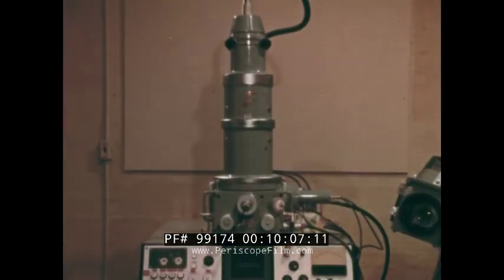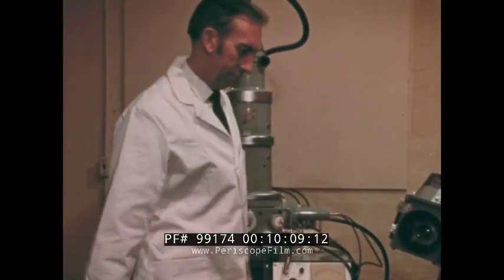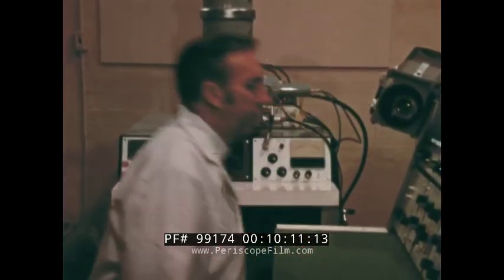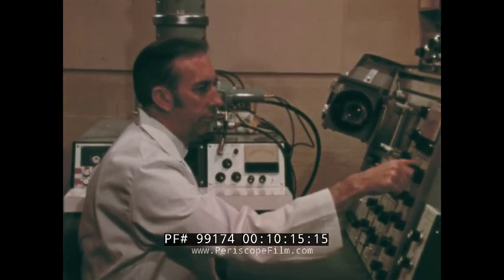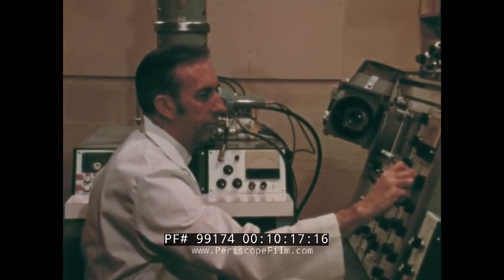How does this new instrument work? Unlike the light microscope and the conventional electron microscope, the scanning electron microscope does not form an image by means of a lens. In the light microscope, light passes through a more or less transparent specimen and then through curved glass lenses in order to produce a magnified image of the specimen. It can be viewed directly by eye or can be recorded on a photographic plate.